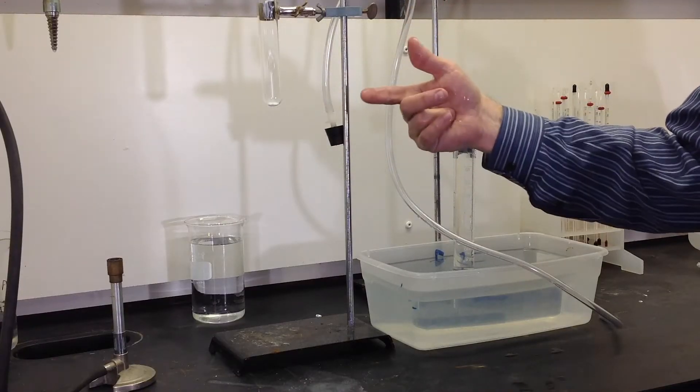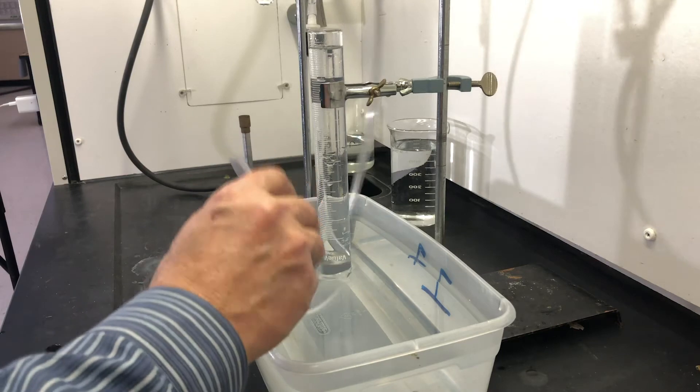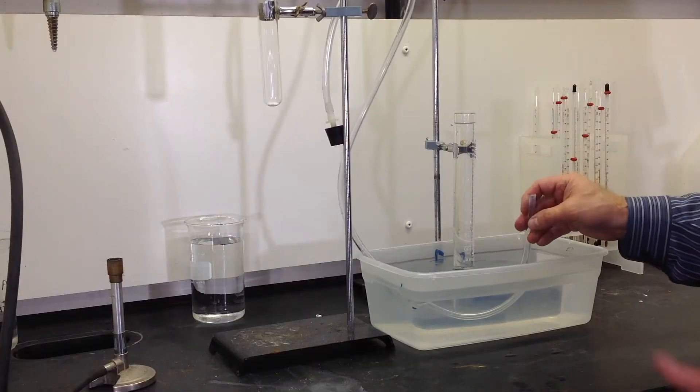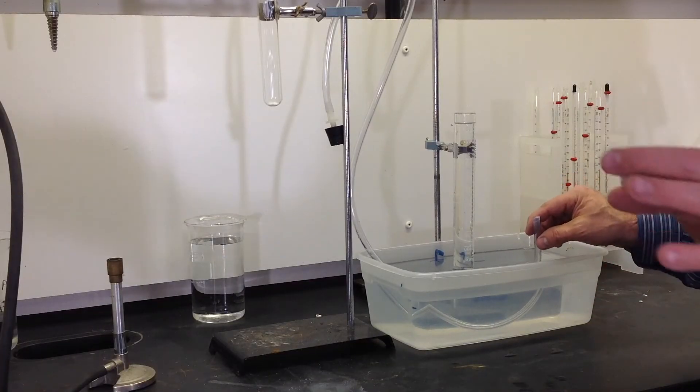Now what we're going to do is add heat to the sodium bicarbonate. That is going to cause the sodium bicarbonate to decompose. We don't want to get too hot because then the decomposed sodium bicarbonate will also decompose and create more gas. The decomposition temperature is around 80 degrees Celsius. We'll get a little above that, but we don't want it to super overheat.